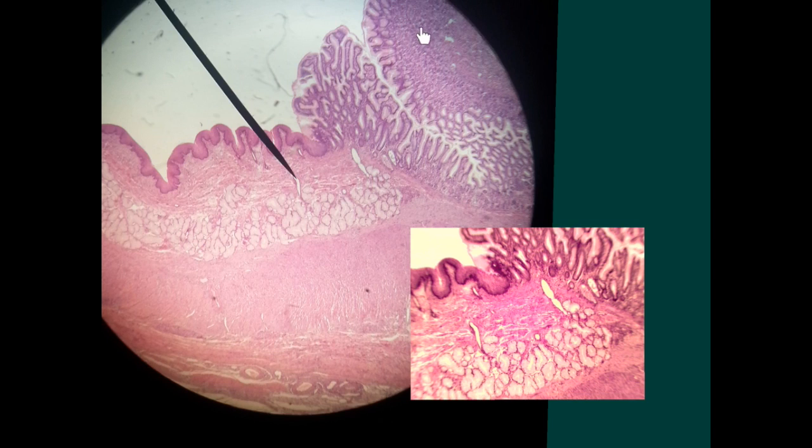But in the case of the other side, you have these irregular white striations. So whenever you see at one side a stratified squamous epithelium, which is compact, and on the other side these white striations, this is the gastroesophageal junction. To make more sure of the judgment, look at the mucus acini under this stratified squamous epithelium. These are the mucus glands of the esophagus, which are present in the esophagus of the dog. And then we have the muscle with more enlargement of the muscle towards the stomach.